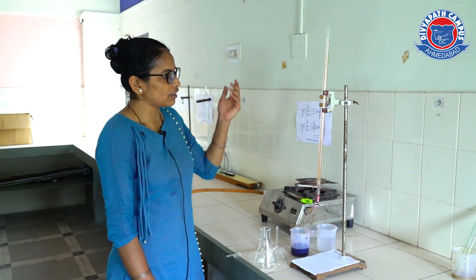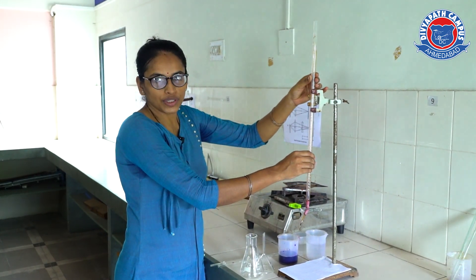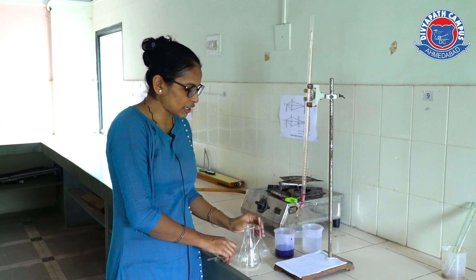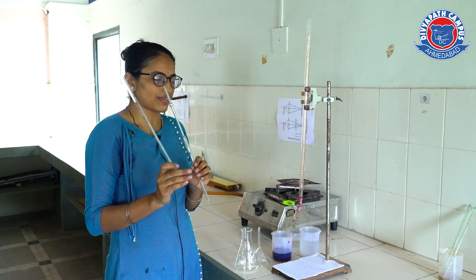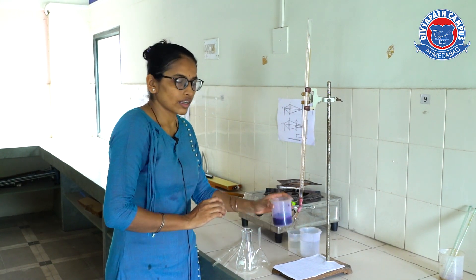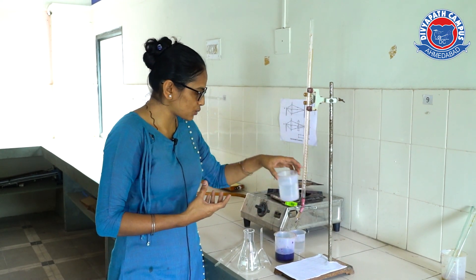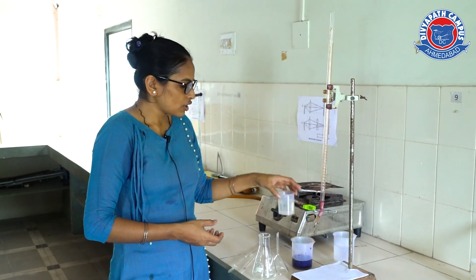For the titration, we need some basic things. You all know: burette, glass burette, conical flask for titration, funnel to transfer the KMnO4 solution, two pipettes — one is 10 ml and one is 5 ml — KMnO4 solution, 0.1 molar oxalic acid solution, and dilute H2SO4.